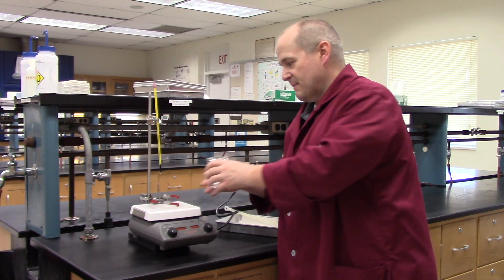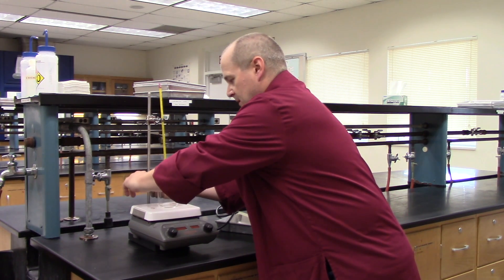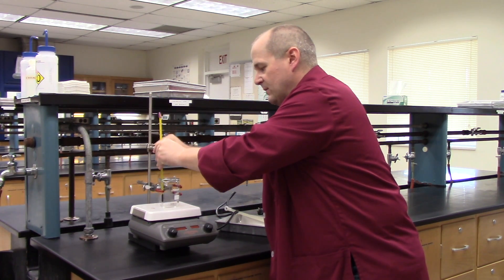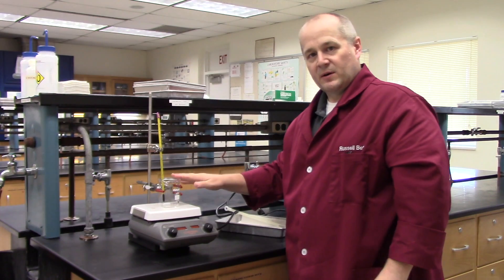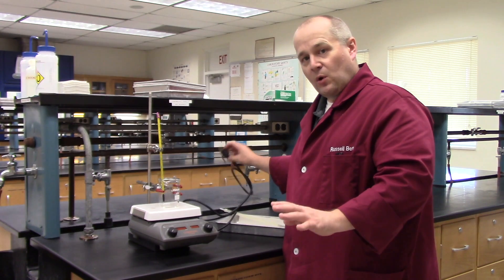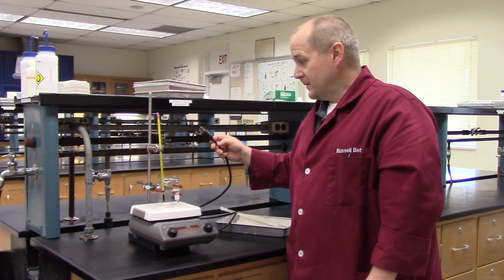Once you've got your fat in the beaker, come back, put it back on the hot plate, and put your clamp back where you need it. Clamp it up. Put the thermometer back in once you have your fat in the beaker. Nothing should be plugged in yet — everything's cold, everything's safe. Put the fat in, then add the base and the alcohol, then plug it in. Then turn the heat on, then turn the stirring on. Nothing should be plugged in until everything is ready to go.